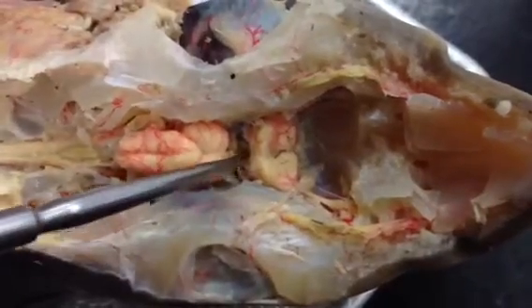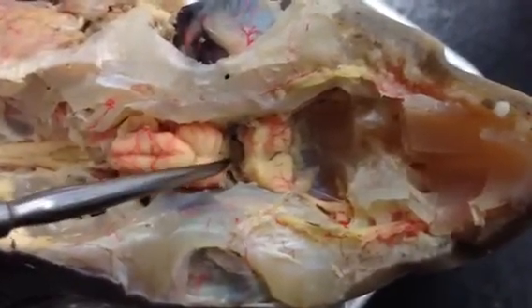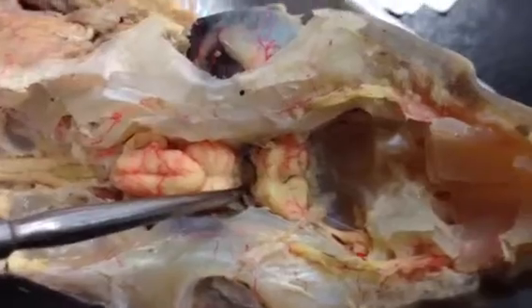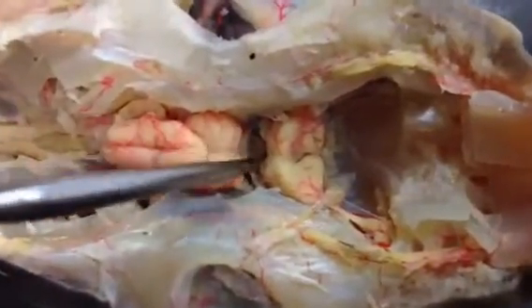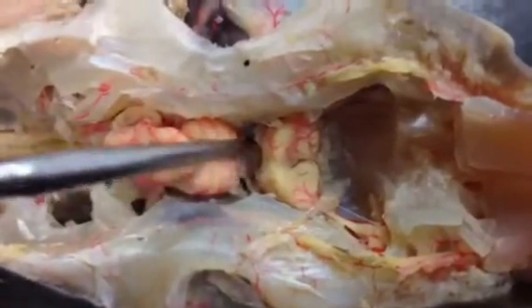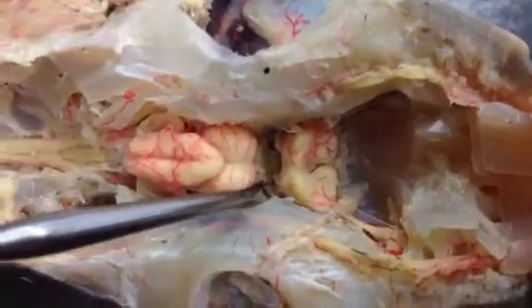The little region right here is part of the diencephalon. All you need to know is that it's part of the third ventricle — you can't see all the individual structures on this one.